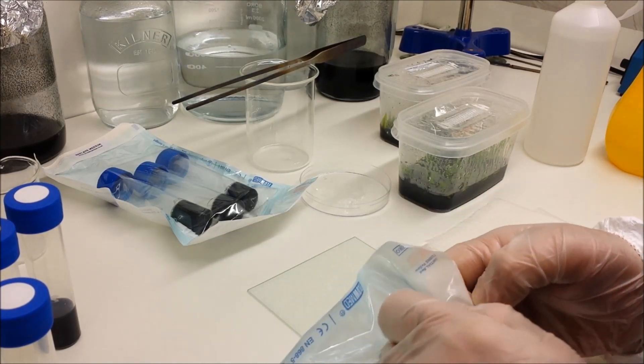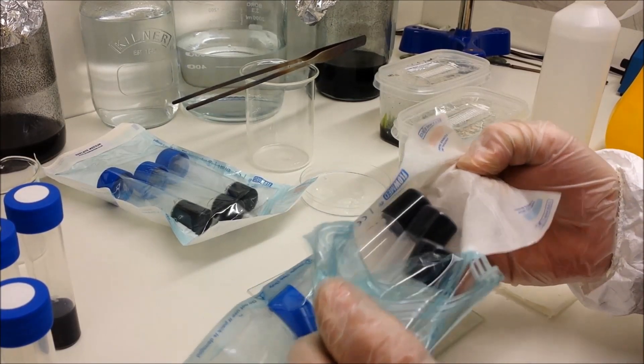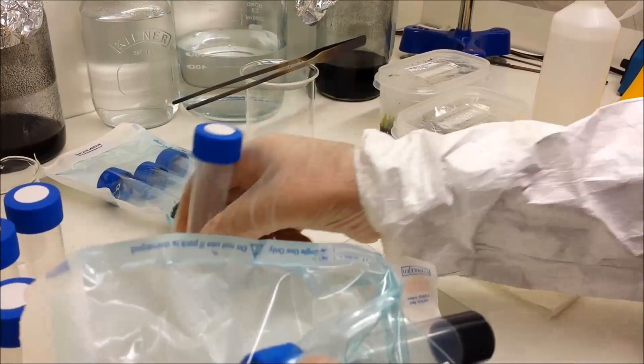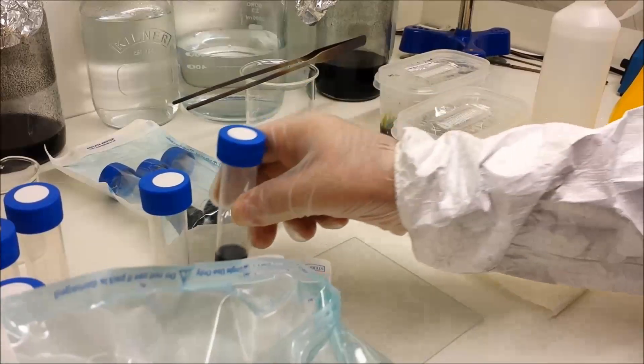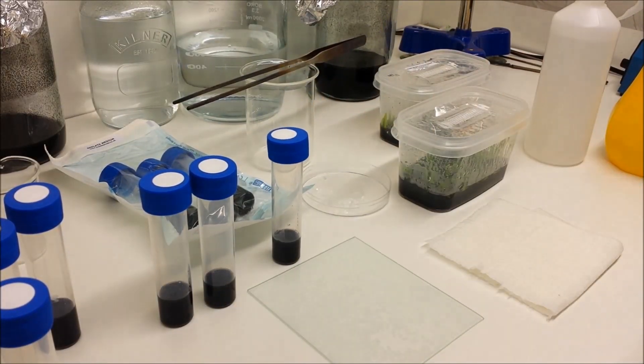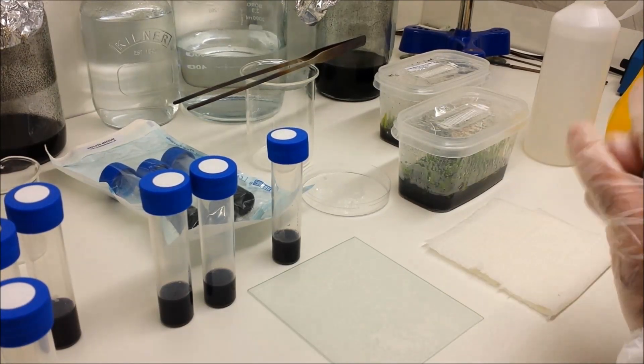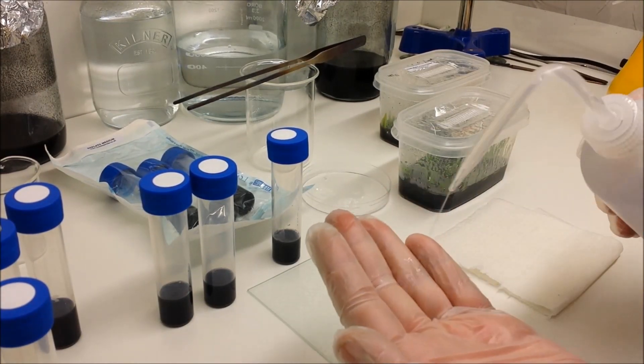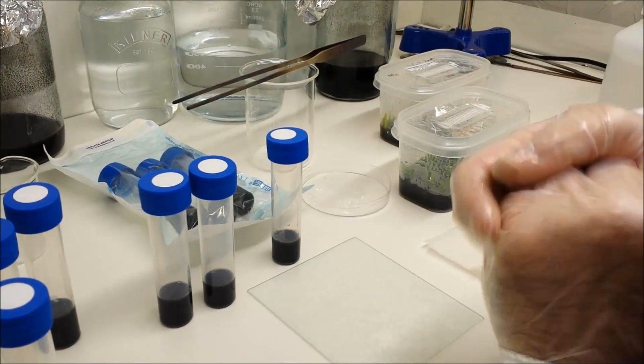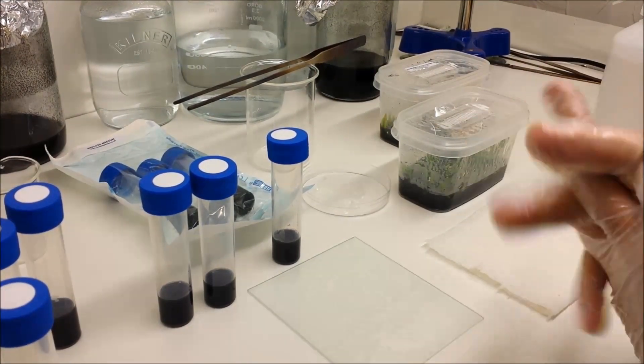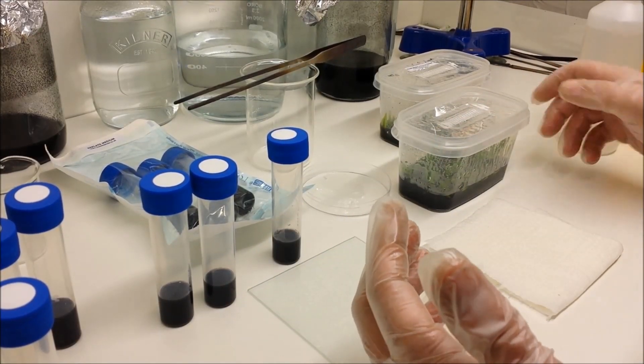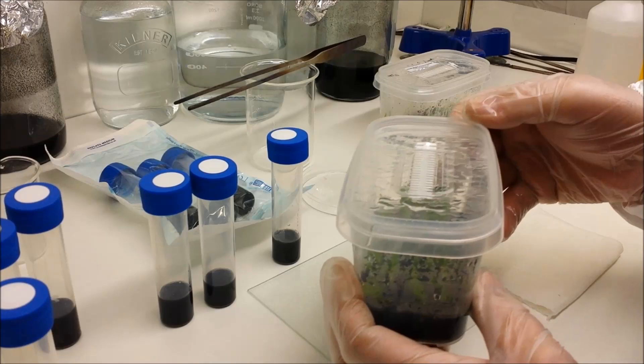So take a bit of time when doing this. Now the flasks inside the packets are already sterilized, so you don't need to wipe those down. These are black at the bottom because they've got charcoal in the mix. Give your gloves another wipe down. Sterilize, sterilize, sterilize—just keep that in mind.